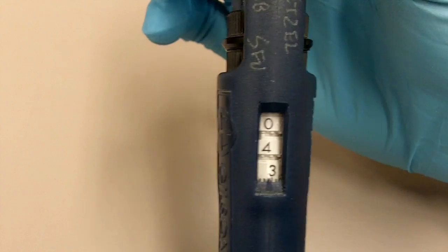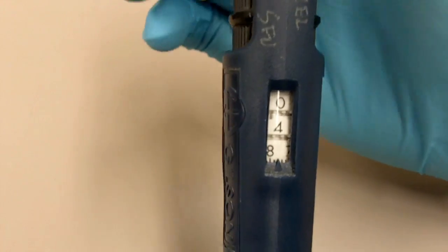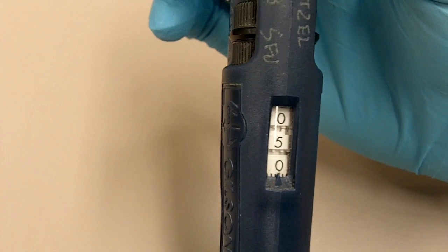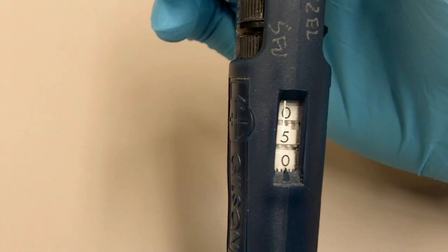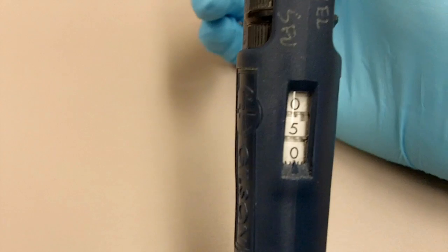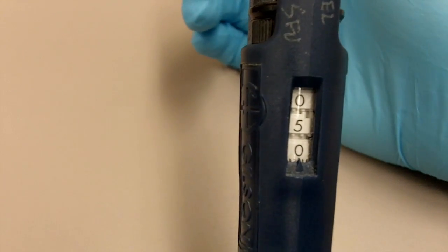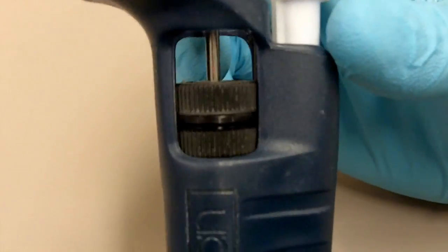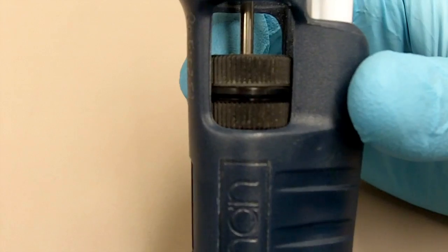Either way, we can decrease the volume or we can increase the volume. So let's set it back to 50 microliters. So if I want to go to 50.1 microliters, I shouldn't use this volume control knob anymore. Instead I'll be using this fine tune knob here.